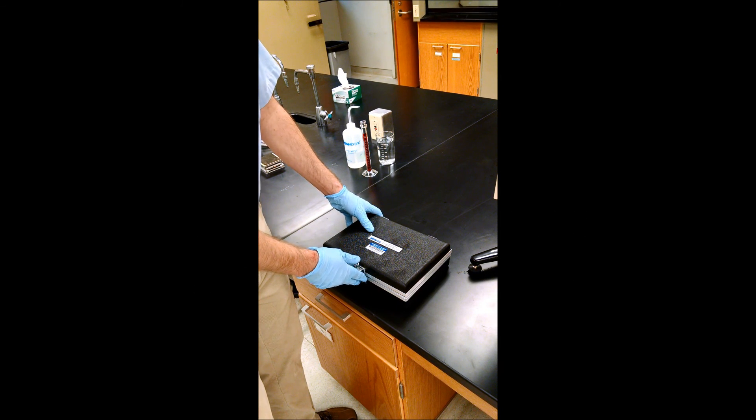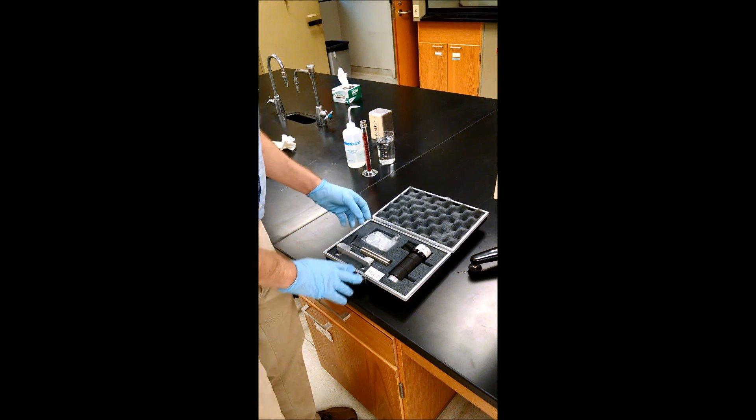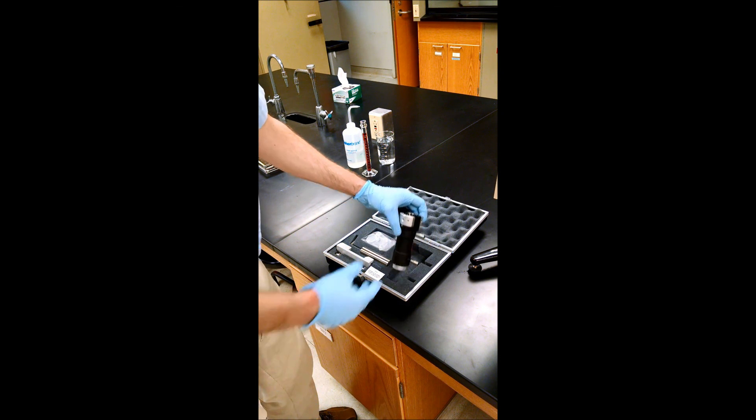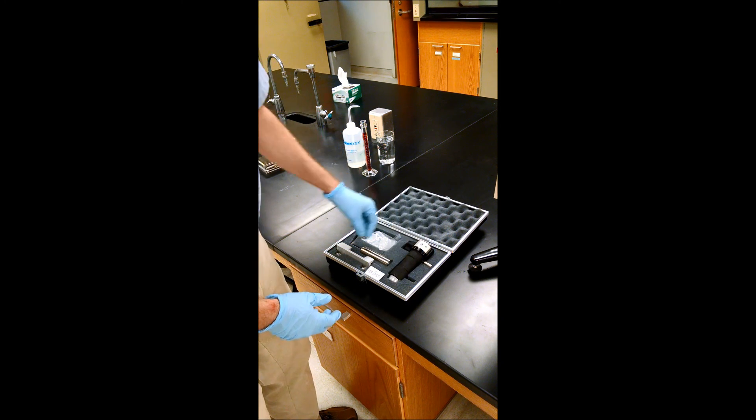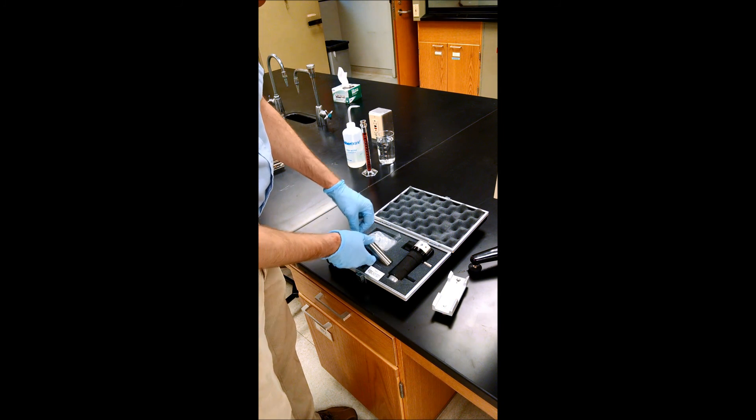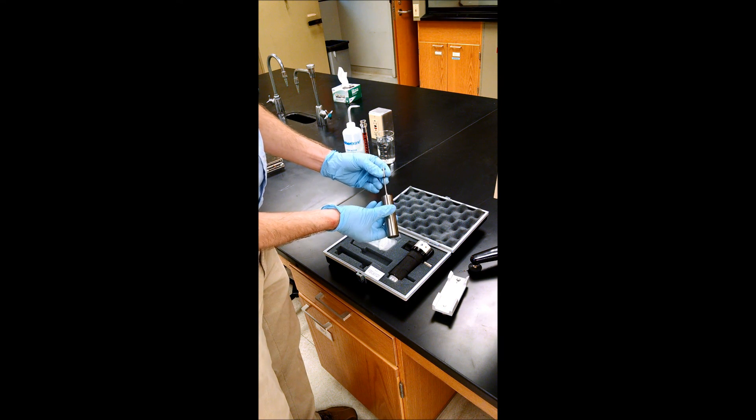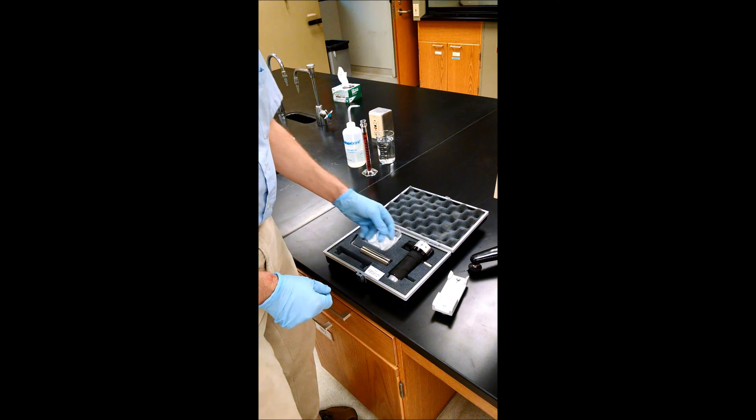Now I'll show you how to attach the ultra-low viscosity adapter. This is the adapter with a water jacket already attached. To attach it to the viscometer we need to use this bracket, and it comes with an ultra-low viscosity spindle and extra cups for samples.